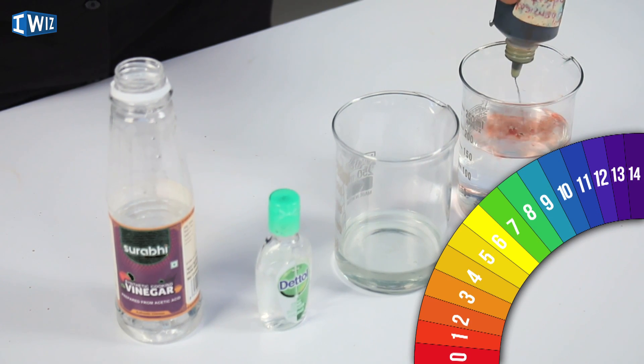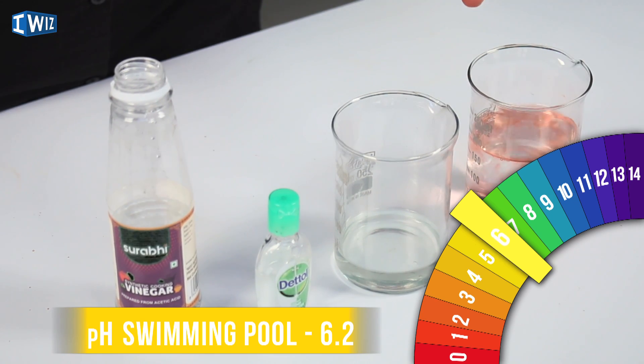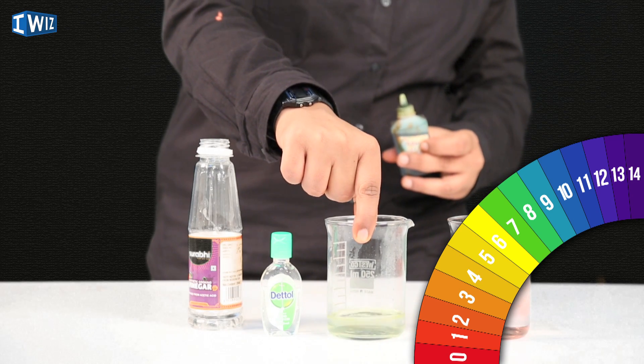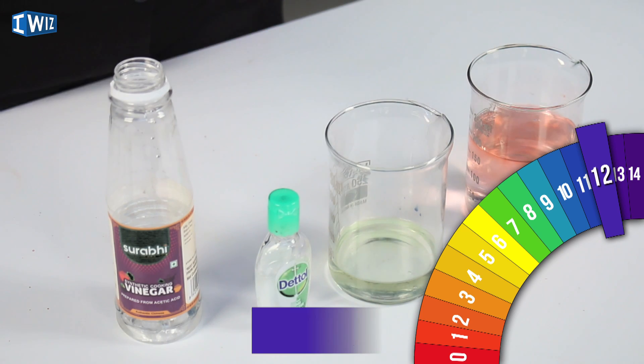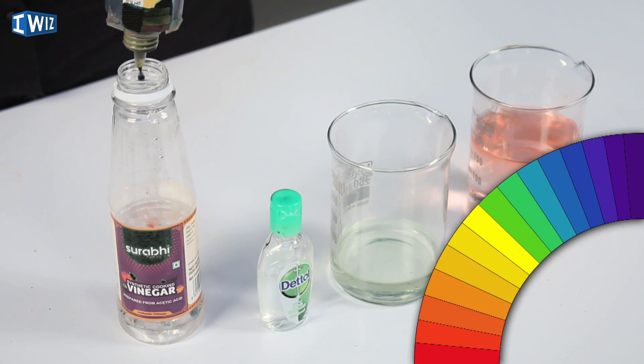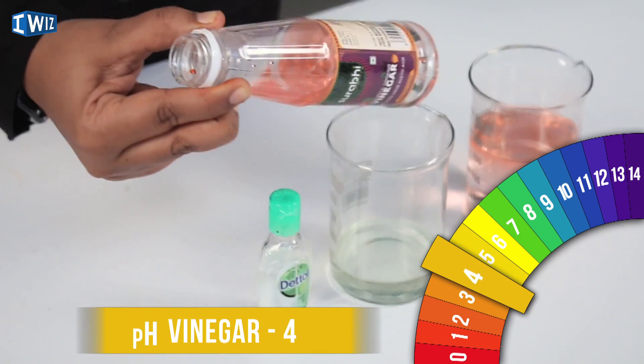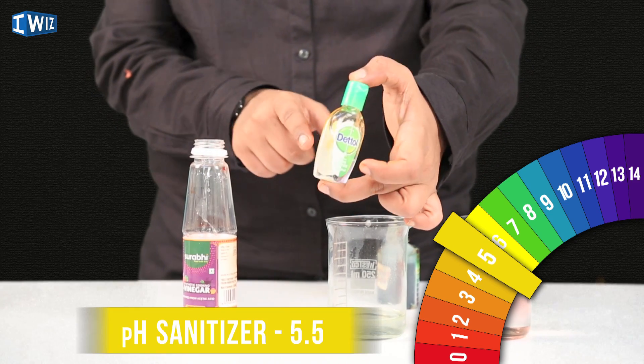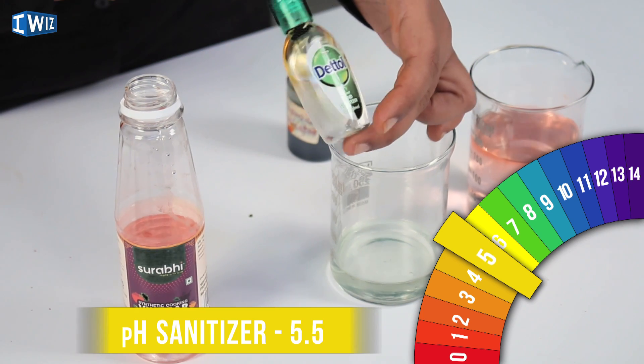Chlorinated water turns the universal indicator a red-orangish color, meaning it is acidic. When I dip the indicator into bleach, it gives a slight yellow color that immediately dissipates — this is because bleach is a very strong oxidizing agent that removes the color from the universal indicator, so I can't reliably test it this way. Vinegar — also known as acetic acid — turns the indicator red, as expected. The sanitizer gives a yellow color, so it is slightly acidic.